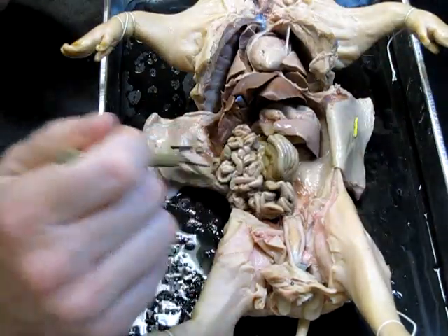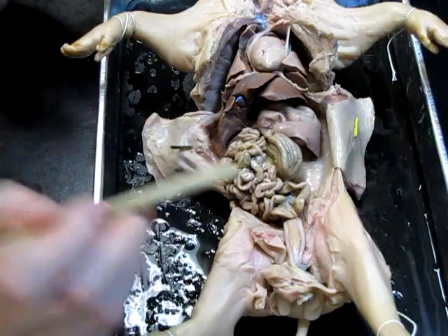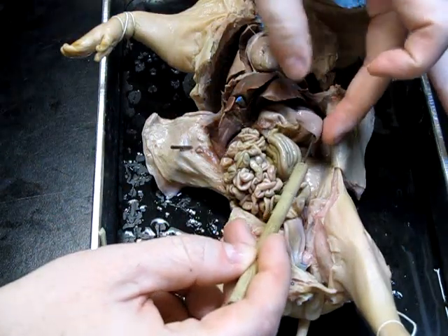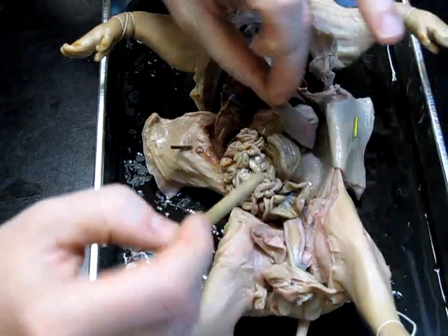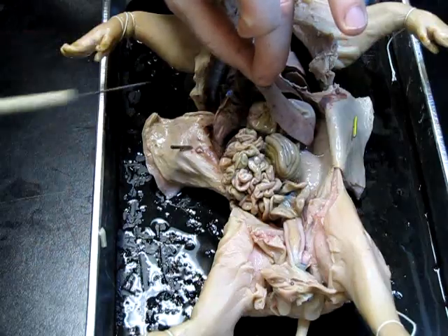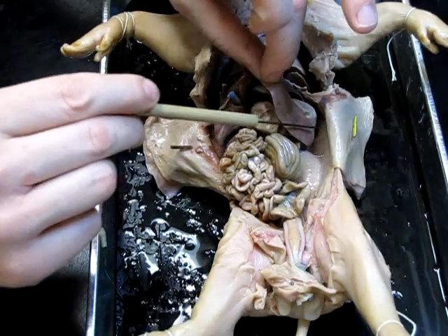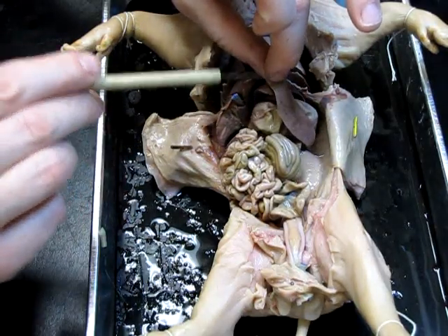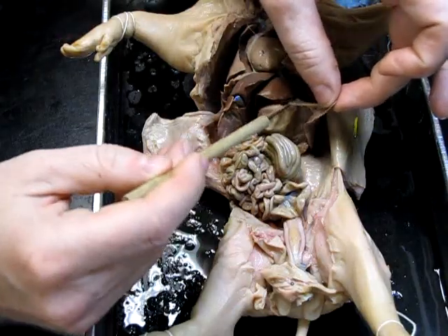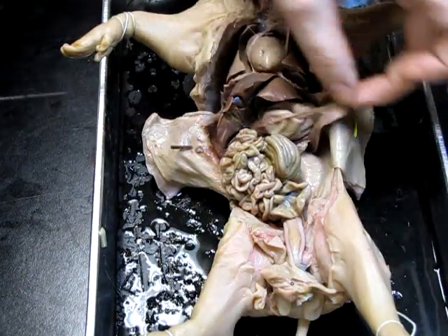The only other glandular structure I'll show you here is this tongue-shaped organ right there — that is the spleen. The spleen is the site of red blood cell production, breakdown, and storage. So that is the spleen.